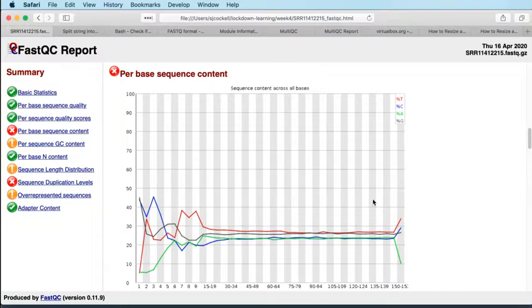It doesn't matter what value those take. So it might be 25% of each, or it might vary from that, 30% of one and 20% of another. But FastQC expects parallel lines as an ATCG distribution across the length of the reads.